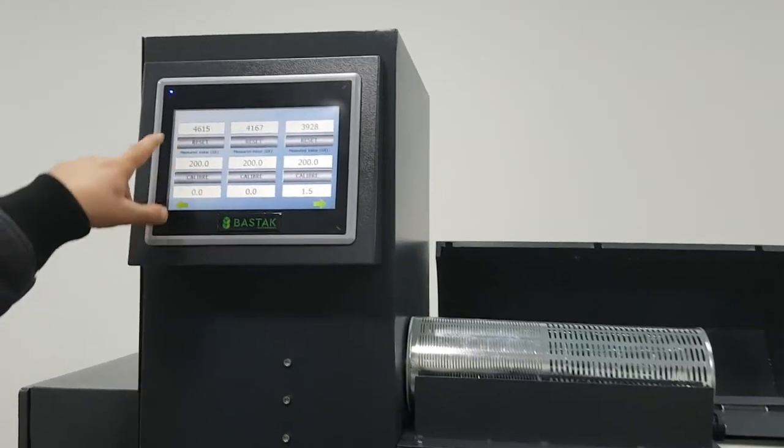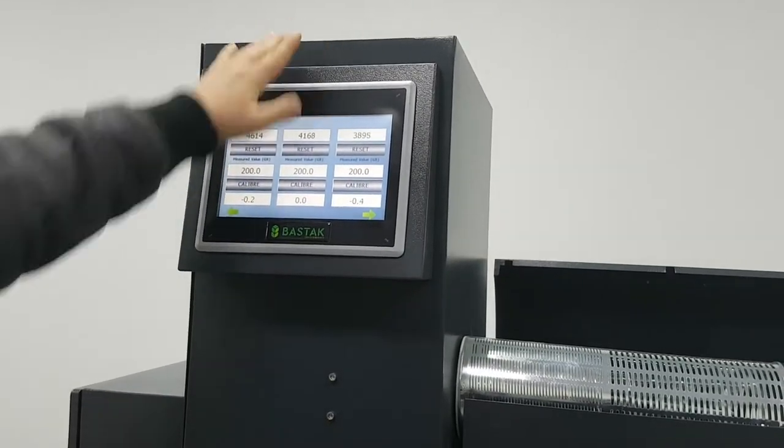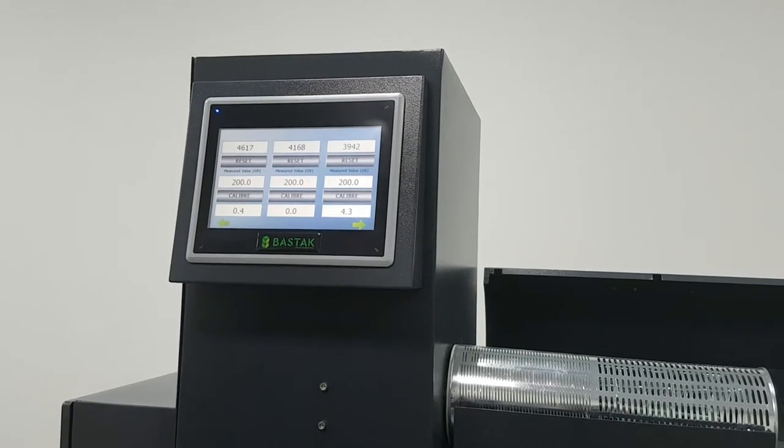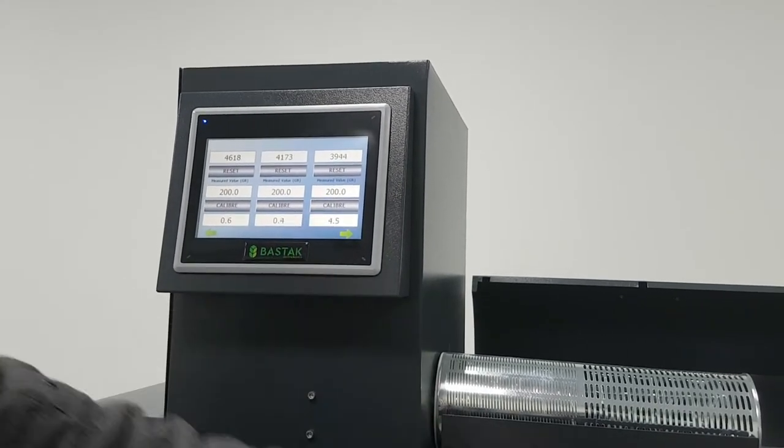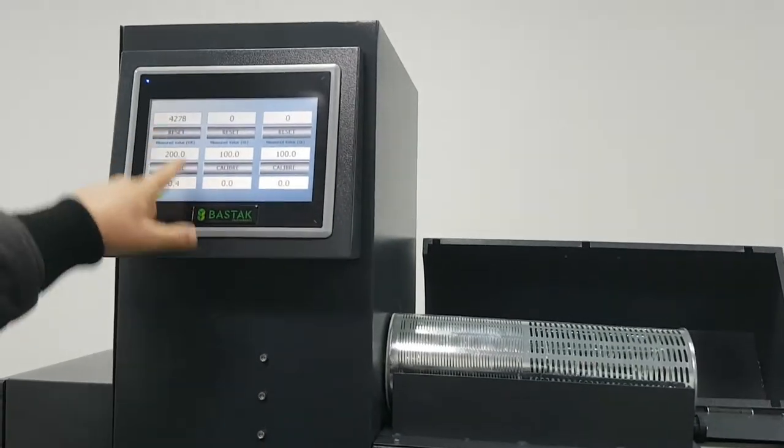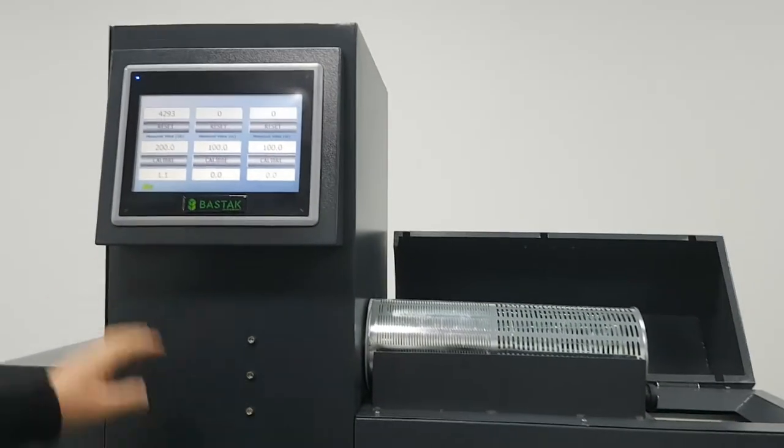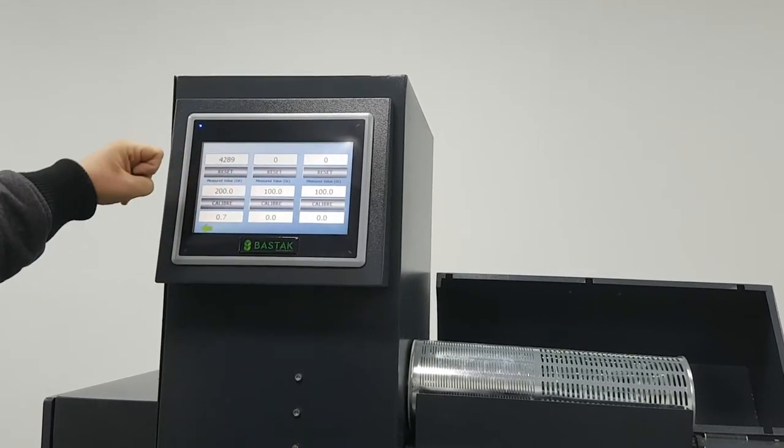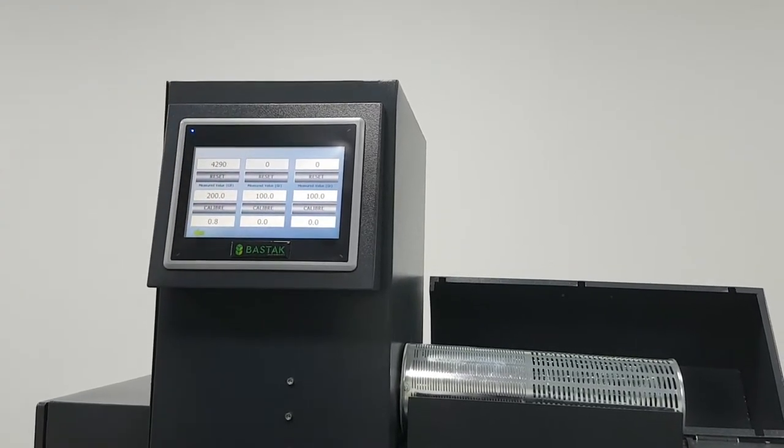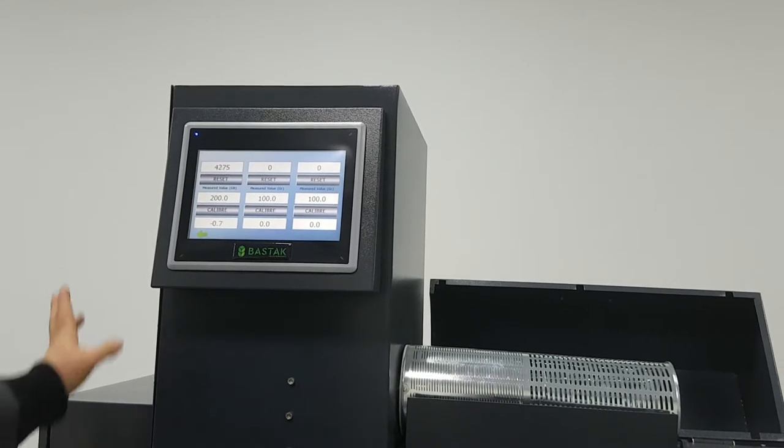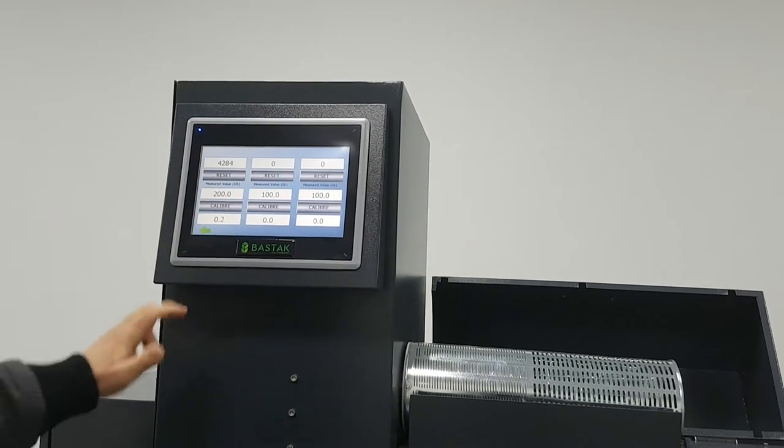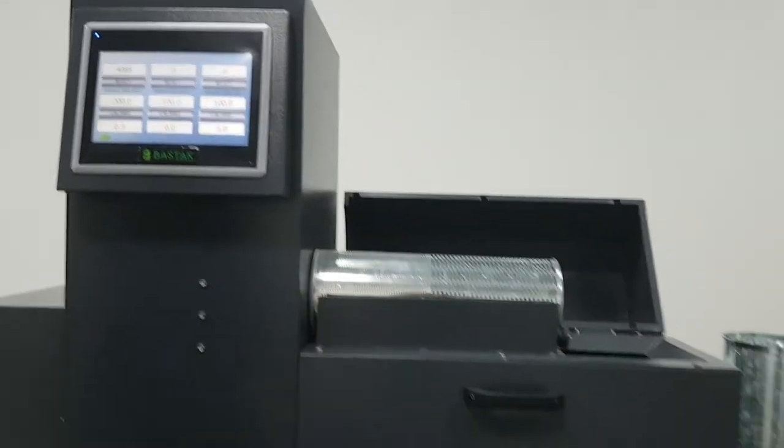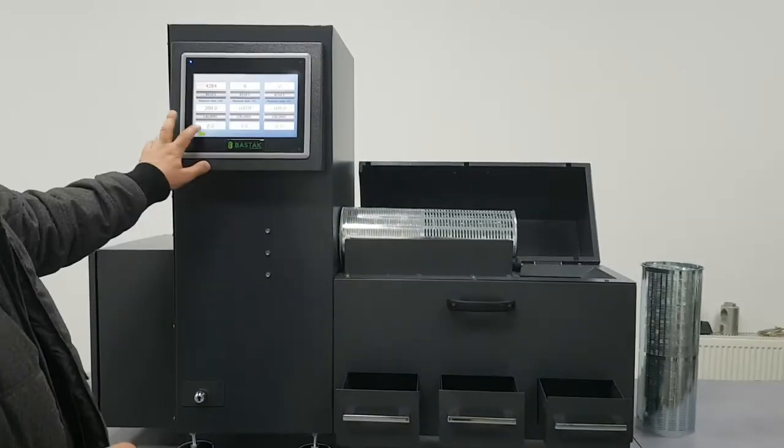We can make calibration for the scales. This one is for the first scale. The second one is for the second scale. The third one is for this scale. And we can go to the next page - the fourth scale is this one. If we want to make calibration, we can add only 200 grams of wheat. We can measure it separately and then add it. We press the calibration and it will make calibration. It's the same for the other scales.